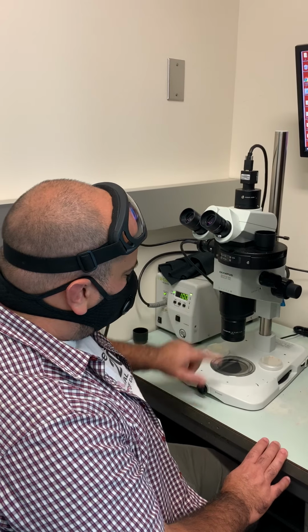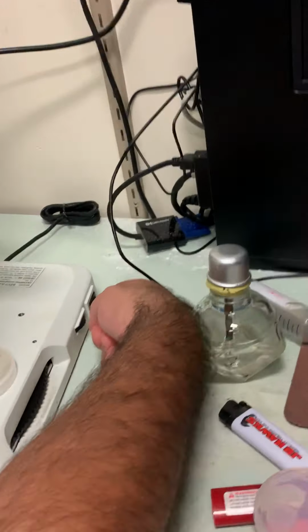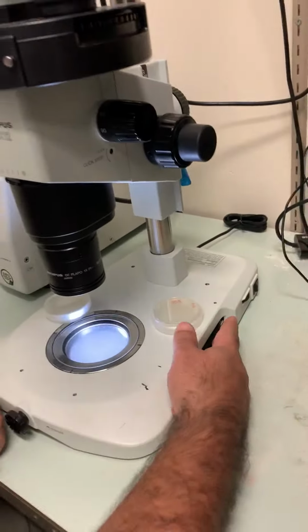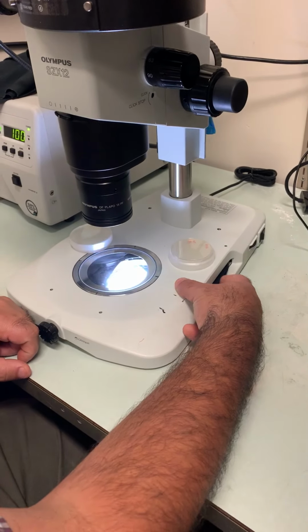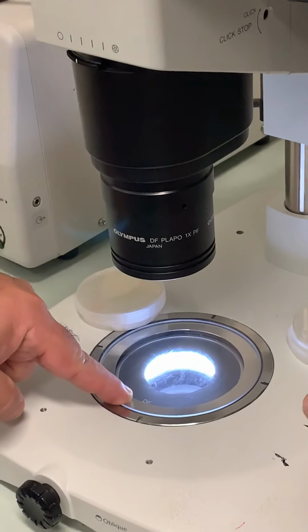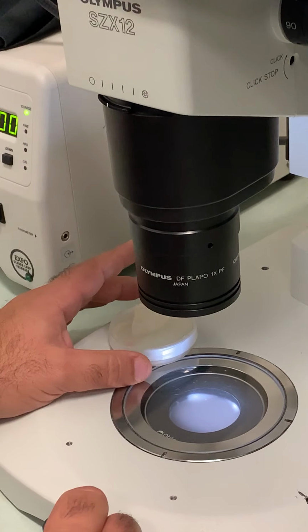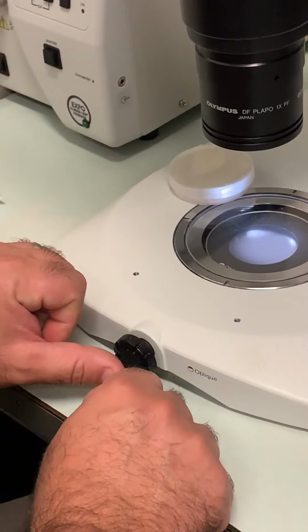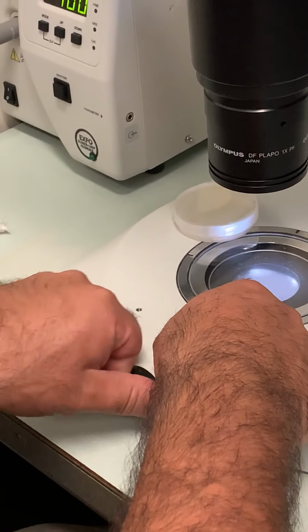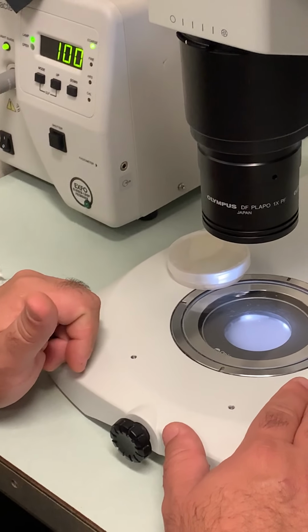This is a dissecting scope. The light switch is at the back here. You can turn it on, and then there is a dial that makes it brighter or dimmer. There is a wheel here that you can rotate to choose different mirrors. The DF is for dark field, and the oblique is the one that we usually use to look at worms. If the oblique setting is there, you can see the mirror moving in angle, which reflects the light in different directions and makes it easy to see the worms.